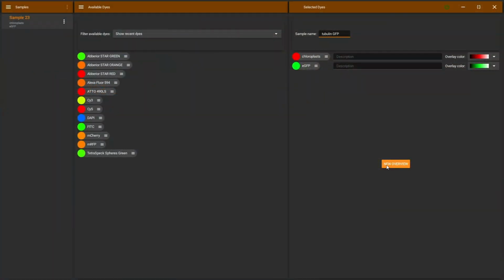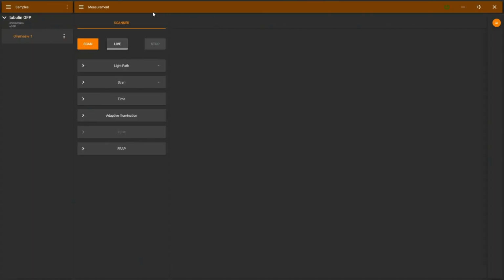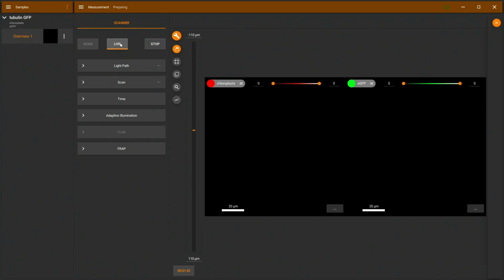Now I'm just naming our sample here. And I'll start a new overview. I can select how large my overview should be when I'm using the tiling mode. I can also select if I want overlaps, which is important for stitching. I'll just go to live imaging now. When I select live imaging, I will get a large overview, basically the whole field of view you can record with a scanner.